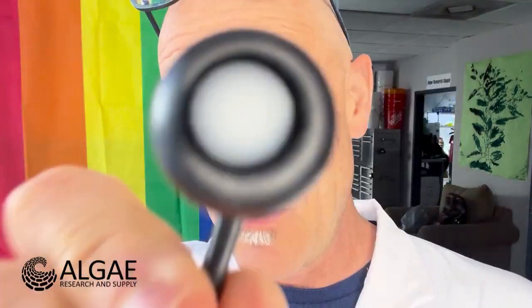No, I'm not a cyborg. This is a PAR meter made by Apogee that is used by Vernier with this meter here. And this is a pretty cool little gadget. So what we're going to do is measure photons of light in between 400 and 700 nanometers.